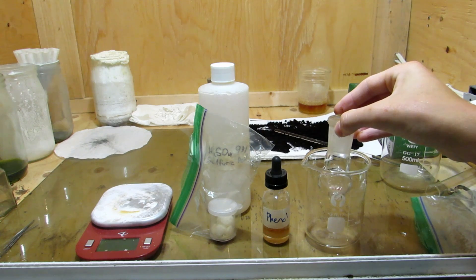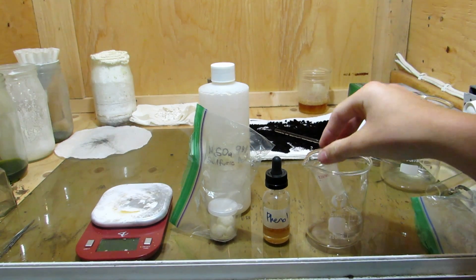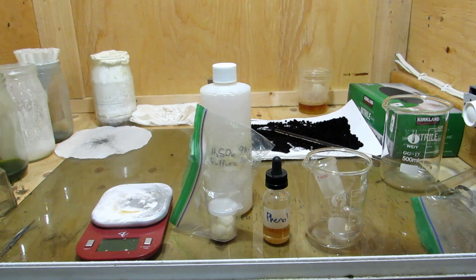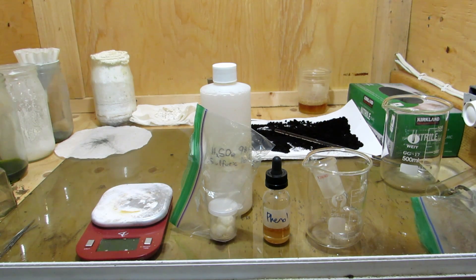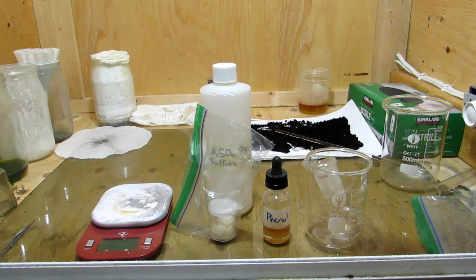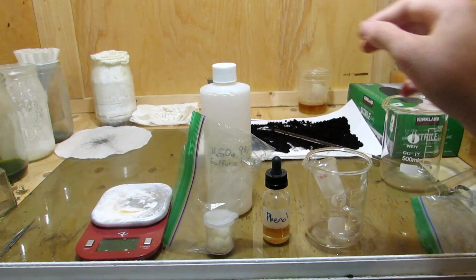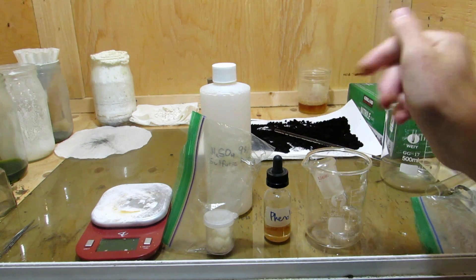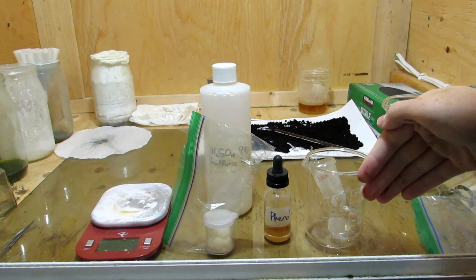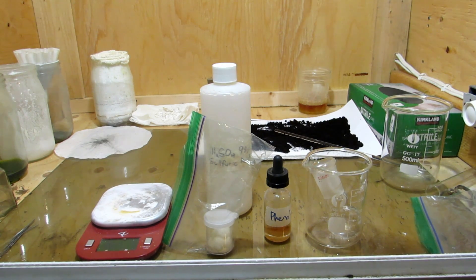Over here I have a small 250 milliliter beaker which we'll fill with oil, clamp in this small 25 milliliter round bottom flask, and heat it in an oil bath for the reaction. The sulfuric acid — after reading online, this reaction industrially is done under a catalyst or under sulfuric acid in acidic conditions, so that's what we're going to try today. We'll add 0.58 grams of phthalic anhydride, one gram of phenol, and about four or five drops of concentrated sulfuric acid into the round bottom flask, then begin heating.